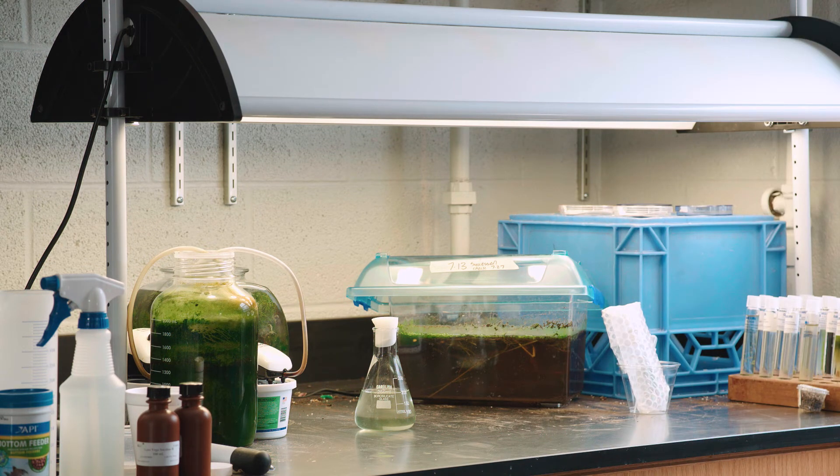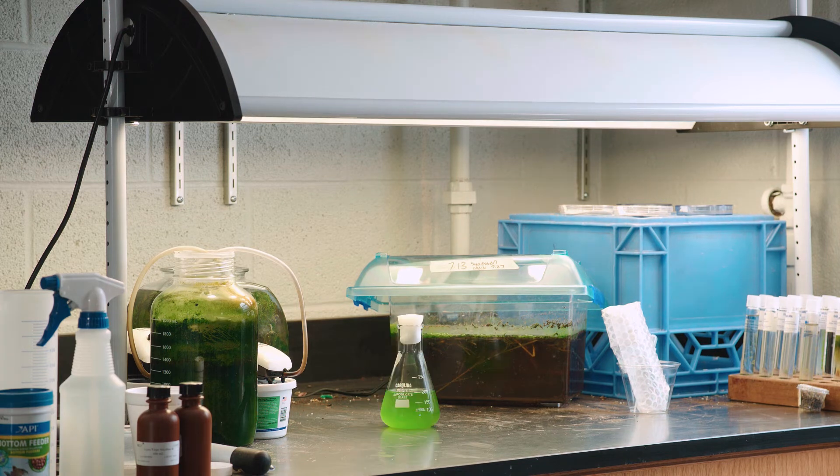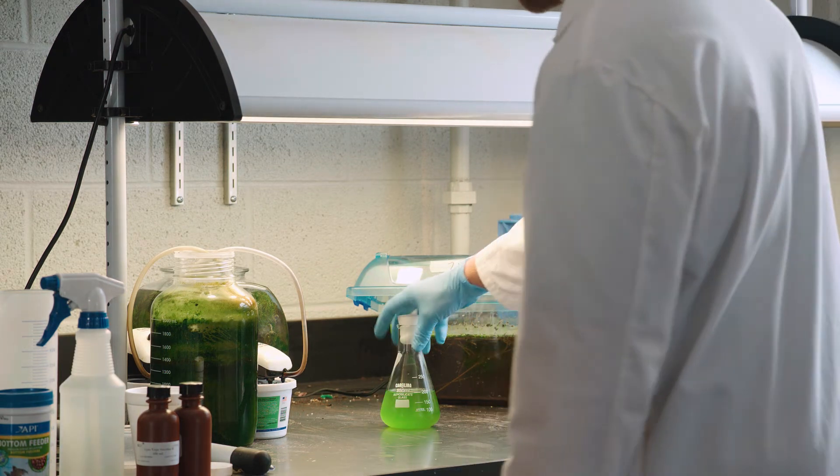We recommend fluorescent or LED lights as incandescent lights often produce too much heat and can harm the algae. After 10 days, move the culture to an area of lower light, usually 50 to 100-foot candles.